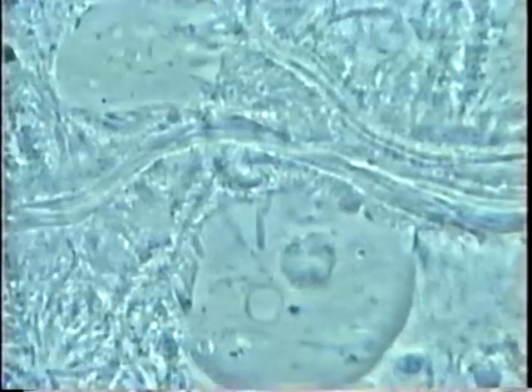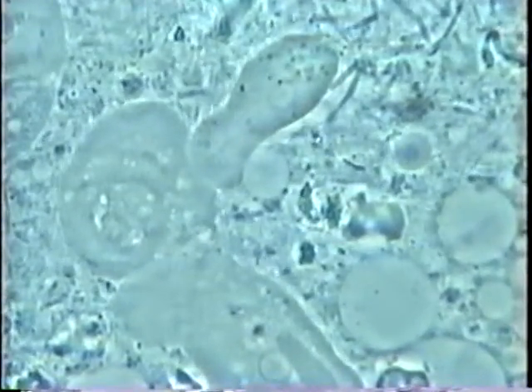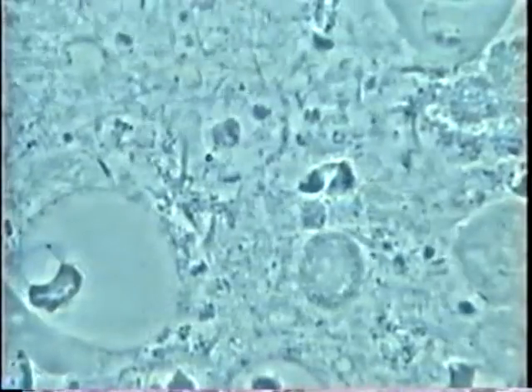Here we have gum disease. Analyzing the biofilms, we see a lot of white cells, then a brush pattern with actinomyces bacteria, and again white cells — so there is infection and inflammation with many active bacteria. Then we see an amoeba nest, a protozoa nest, where they live with the actinomyces filaments, and many denucleated white cells.